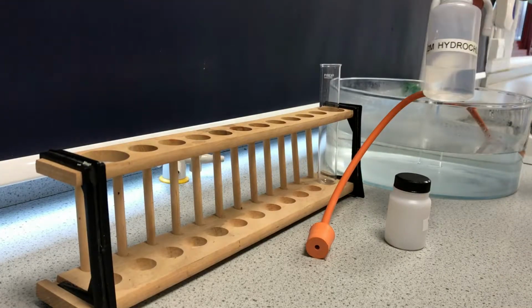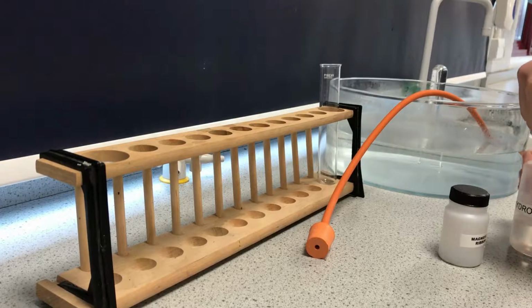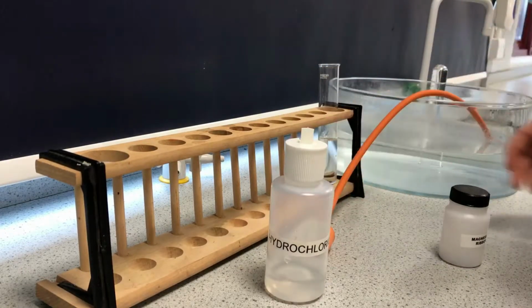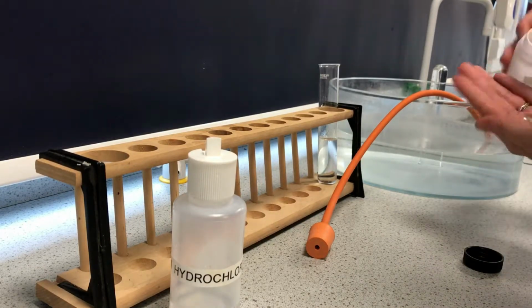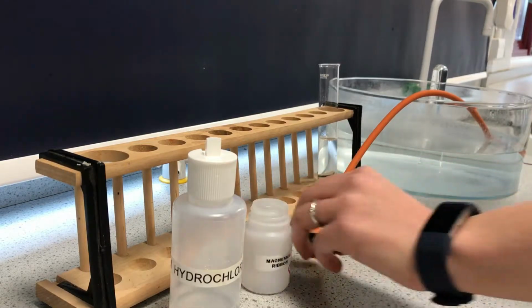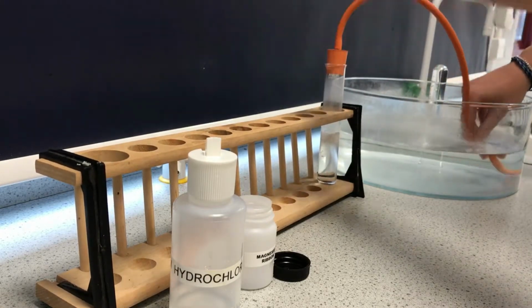So I have some 2 molar hydrochloric acid and I have some magnesium ribbon, and I'm going to put them together in this boiling tube. I don't want to overfill it, so I want to have enough of a reaction but not allow the reaction to go over the top of the boiling tube. I've got maybe 5 pieces of magnesium ribbon. So I'm going to put those into my acid, immediately fizzing, releasing lots and lots of heat because it's an exothermic reaction. We'll talk more about that later.